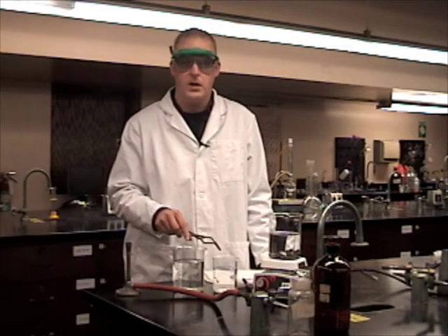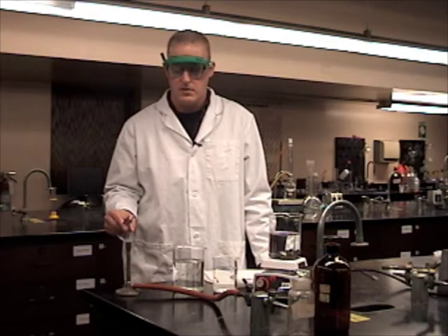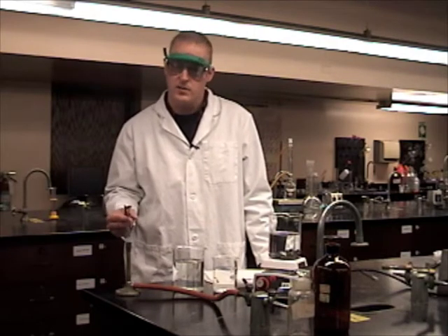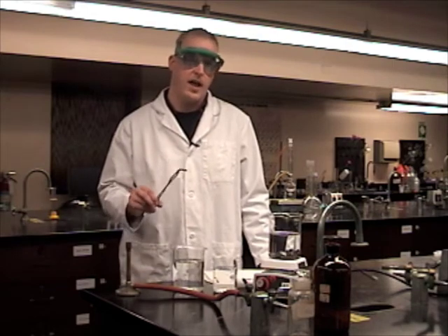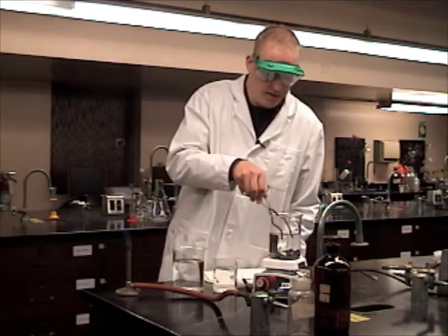We rinse it off really quick. We're going to heat it up and then as we superheat it, we're going to cool it down rapidly in some water and you're going to have some gold pennies. So we're going to walk through that process.